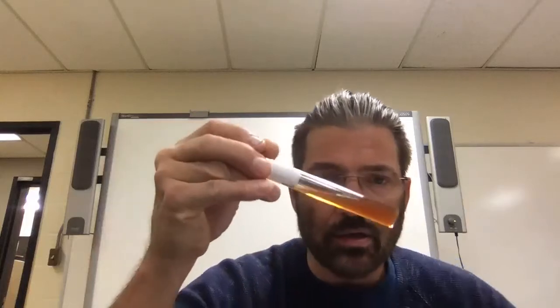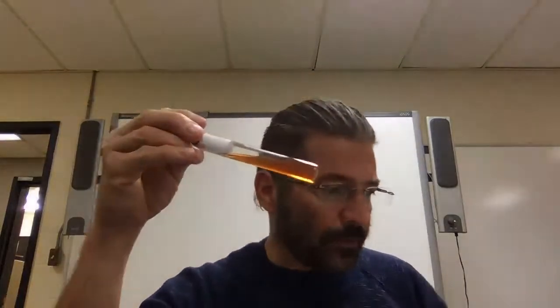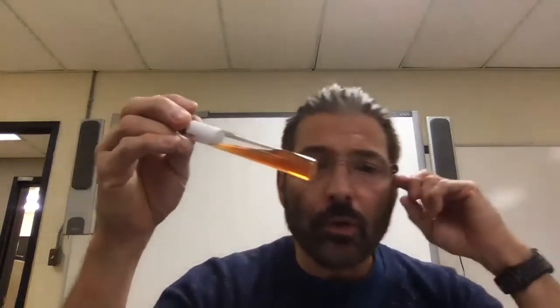Unless the microbe doesn't like oxygen, or has no peroxidase or no way of dealing with oxygen, it'll grow in anaerobic conditions. But it's growing on the slant here, where there's a much higher oxygen concentration. They're going to grow much, much faster, so we want a short incubation time, which I talked about with the MRVP test.